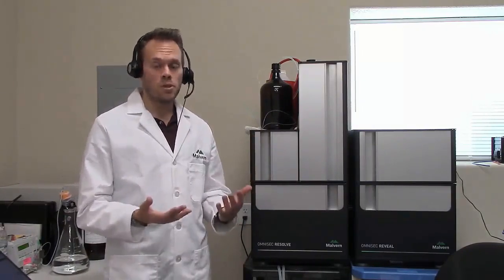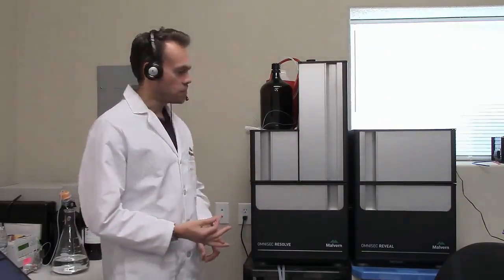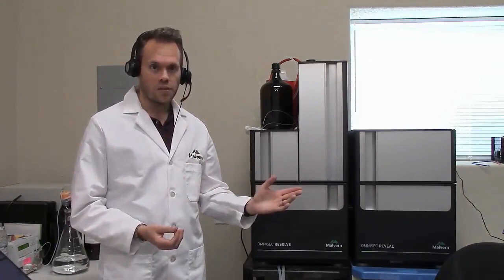So if you're going between pure organic solvents, chloroform and THF for instance, you can do that in an hour. If you're going between buffers from one aqueous buffer to a different one, or from buffer to water methanol, you can go straight there without an intermediate step, and so you can do that in about an hour. But for this kind of situation, or maybe you were running DMF with lithium bromide and you want to go back to THF, flush out all the salt first with pure DMF, then switch to THF, and that's going to take a couple more hours.